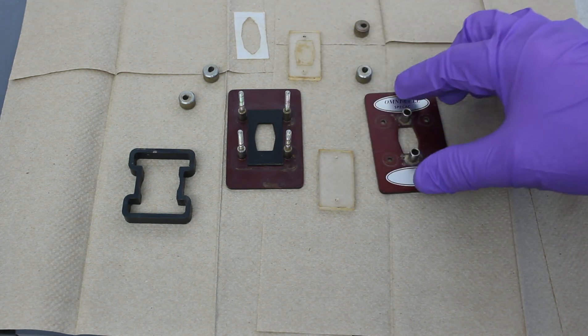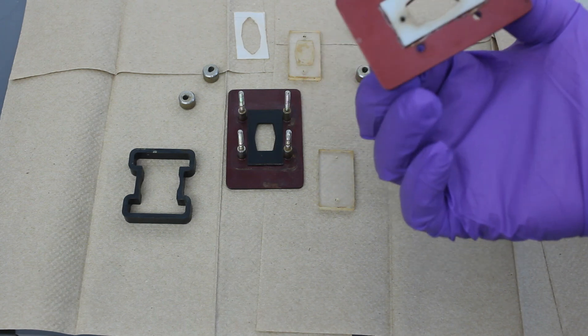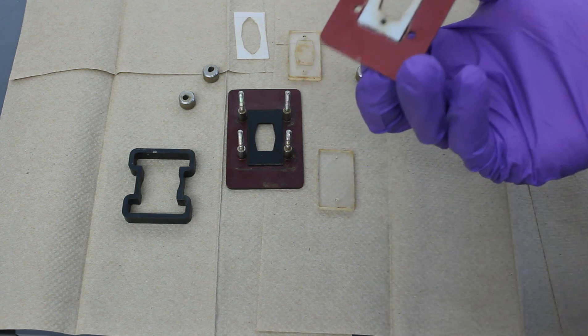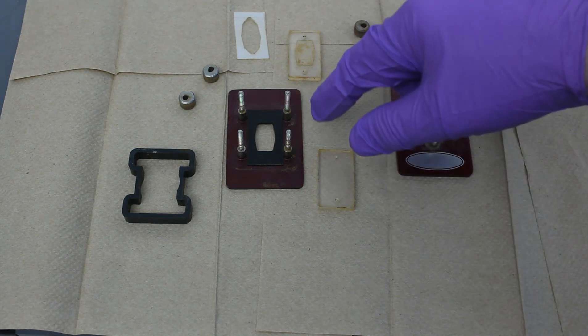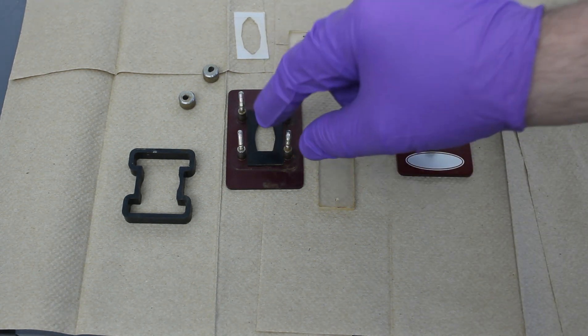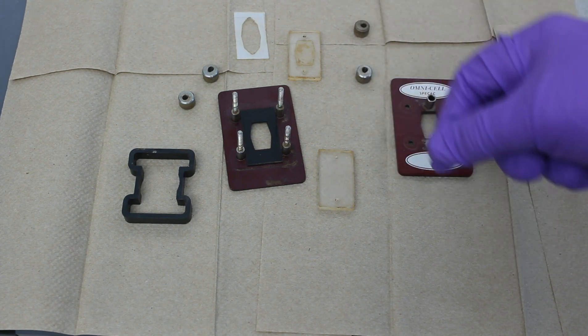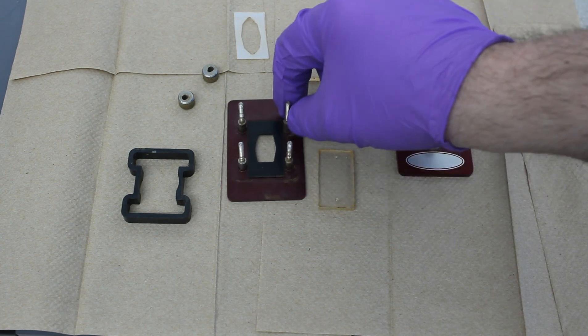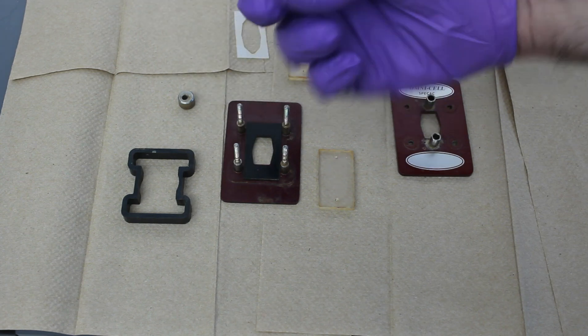Now, you can see corrosion. That's essentially from normal usage of the plate where you get iron or other metal stains onto the plate. So you want to be careful. What I like to do is on these metal parts, these metal threads, I will spray some WD-40 on them and then wipe them down. And that helps remove the rust, the corrosion, and prevents any of the threads from getting damaged when you tighten them back up with these bolts.